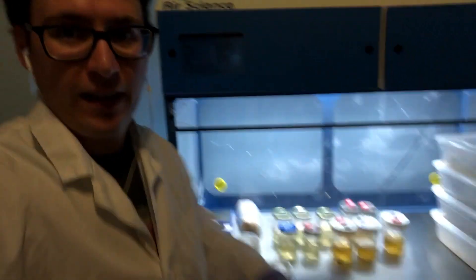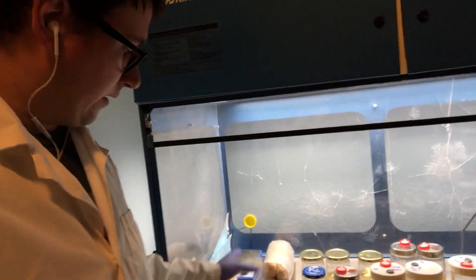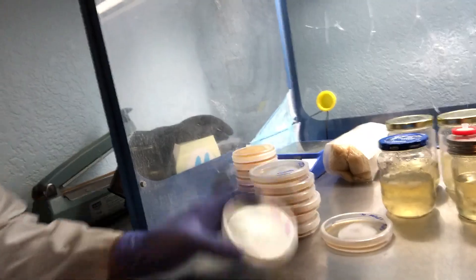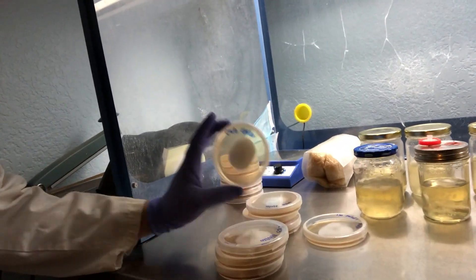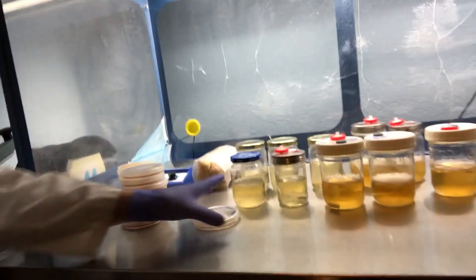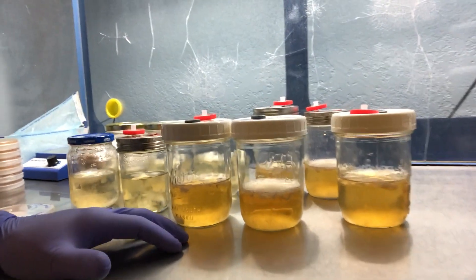I'll go down to the lab and show you guys how those are progressing. It's really cool to see these different strains developing and I think we're going to be getting some fruits here soon. So I've got everything laid out in the hood. We've got about eight more runner-up strains that I'm going to be doing out on liquid cultures — they're looking really healthy, they just didn't have as fast growth as those first five. I'm going to be doing 13 total trials.